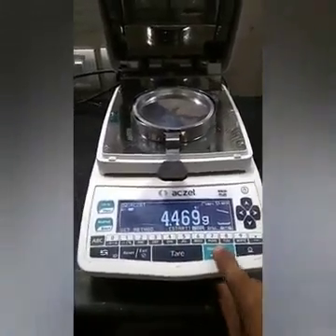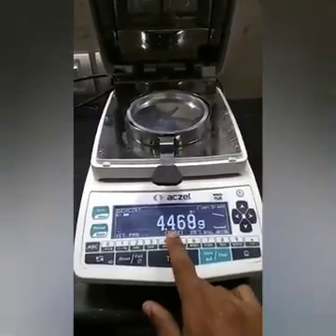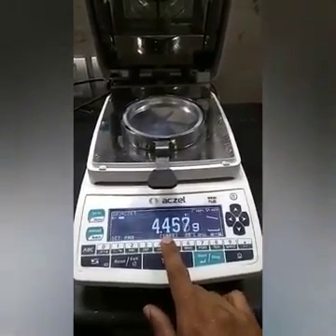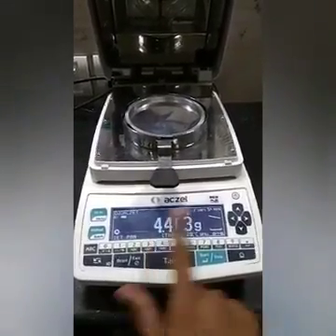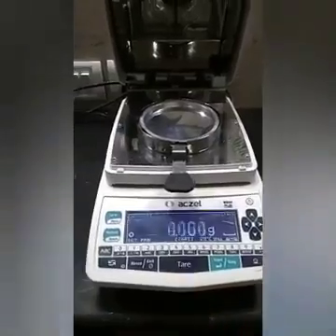Just press the start button from here. Now it is showing 'tare'. Press tare — just follow what is written here. Don't make any changes, just press tare.